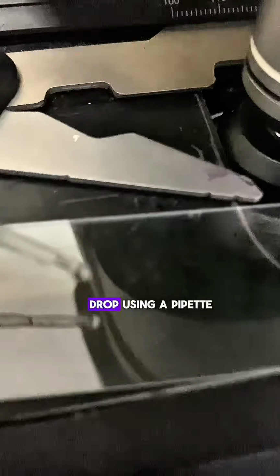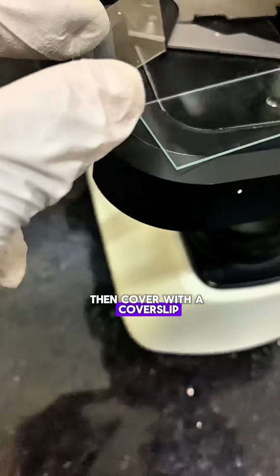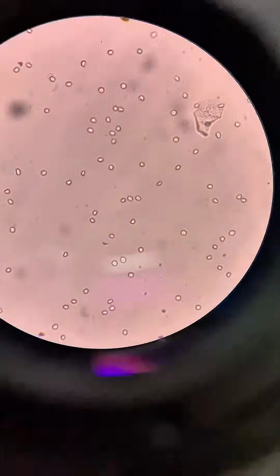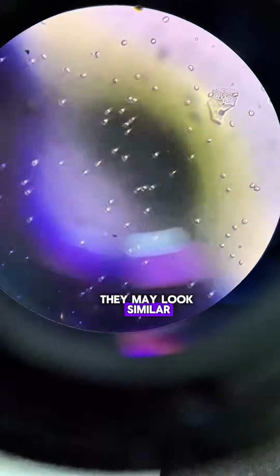Then I took a drop using a pipette and placed it on a clean glass slide, then covered it with a cover slip. Then I examined the urine sediment using the 10 times and 40 times objective lens. Under the microscope, red blood cells and pus cells or white blood cells may look similar, so let's explore their differences.